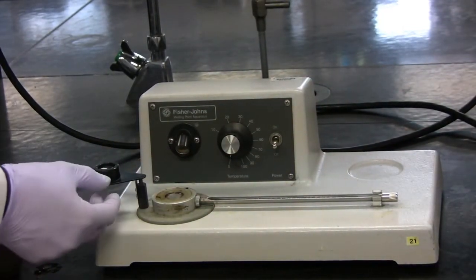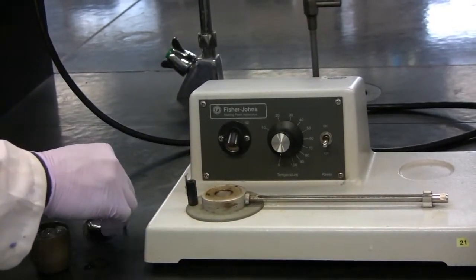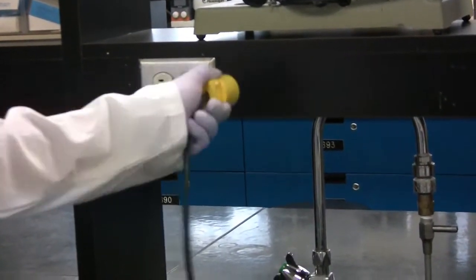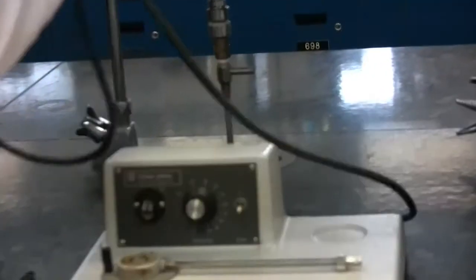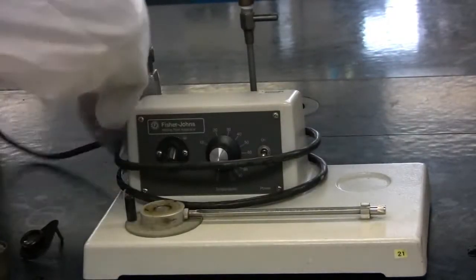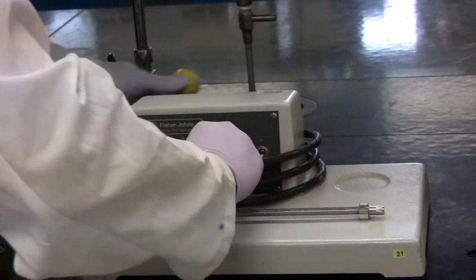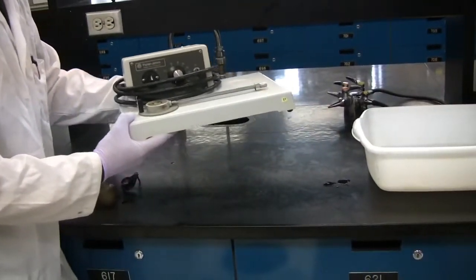Disassemble the lens piece. Make sure to hold the plug while unplugging the machine. You need to rewrap it the way you found it, as shown. Once finished, put it back on the shelf above you.